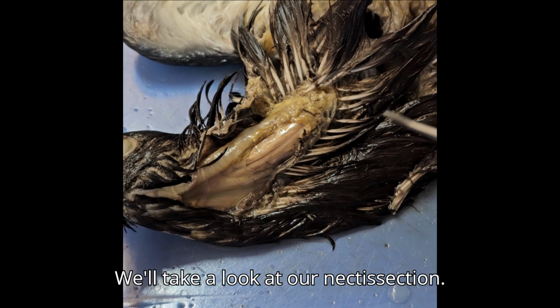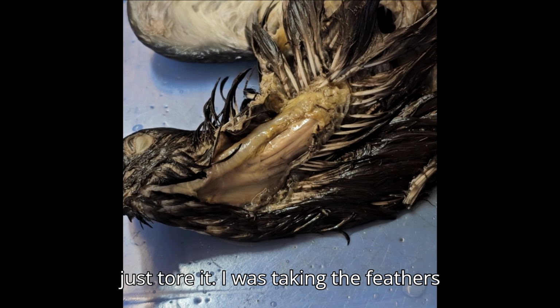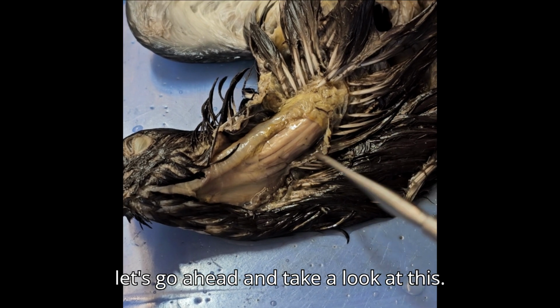We'll take a look at our neck dissection. What I did is, well, really I just tore it. I was taking the feathers off and it tore open. So I thought, well, let's go ahead and take a look at this.